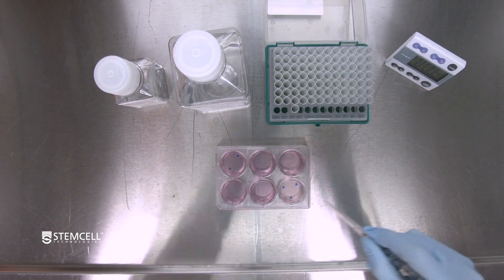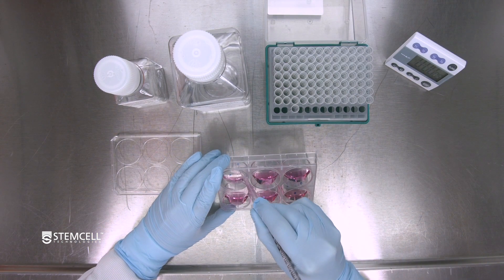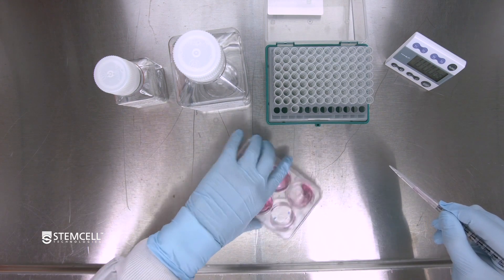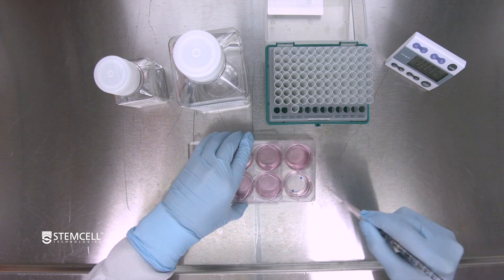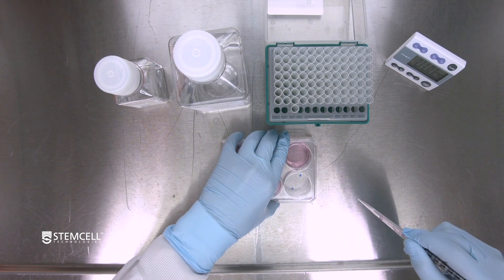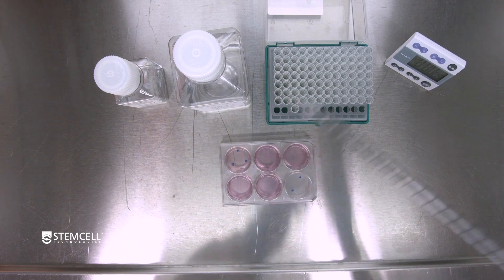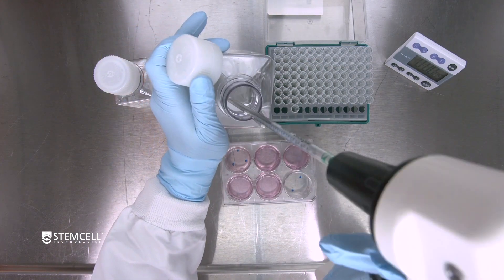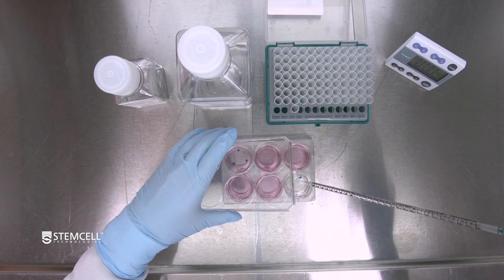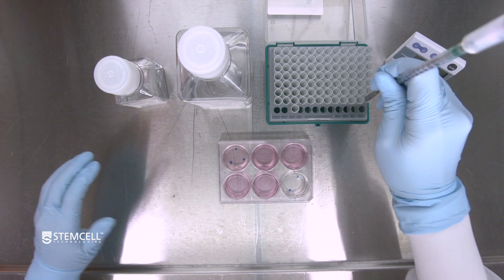Place a sterile P1000 tip on the aspirator pipette and remove half the medium from each well. Aspirate the regions of differentiation from the well, then remove the remaining media. Note that regions of differentiation can also be removed by scraping with a pipette tip. Add 1 ml D-PBS to each well, then aspirate the PBS.